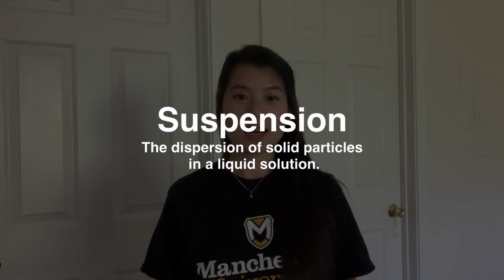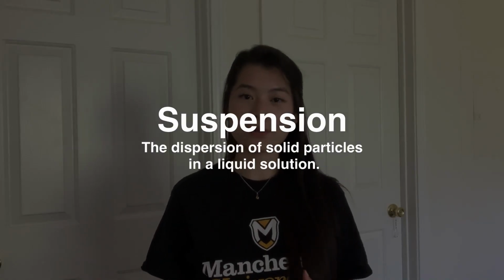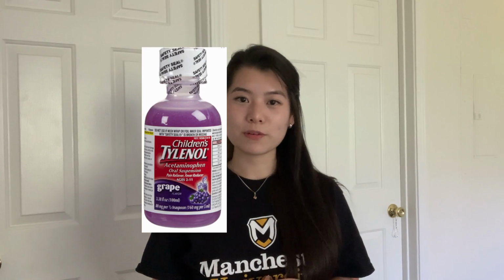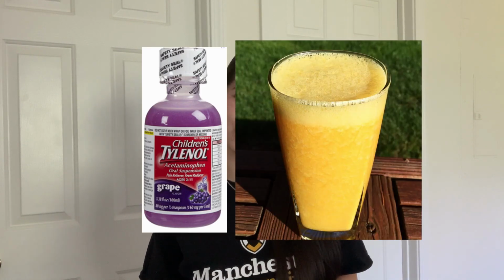For my first demonstration, I'm going to be making a cookies and cream pudding, and that's going to be equivalent to making a suspension in the pharmacy. Now, a suspension is another word for a liquid solution with small solid particles dispersed in it. Some suspensions that you may be familiar with are liquid fever medications and orange juice with pulp.